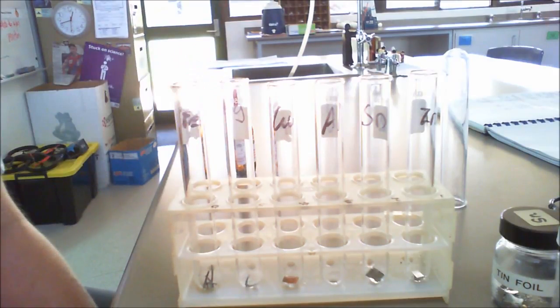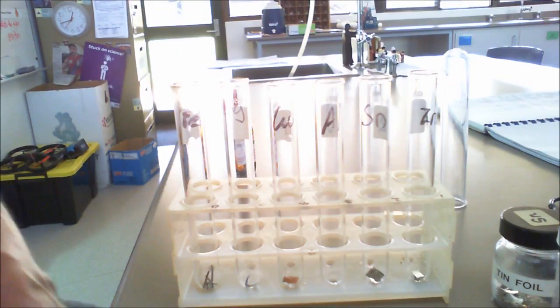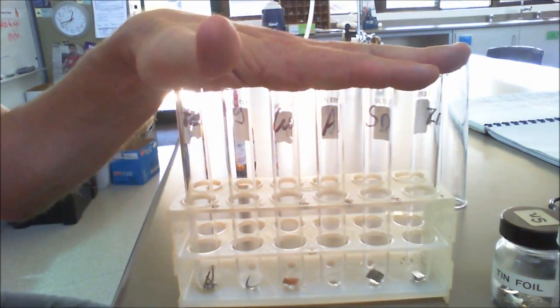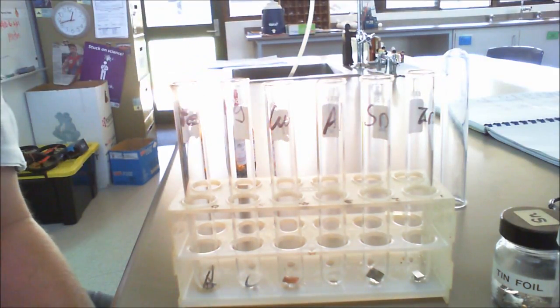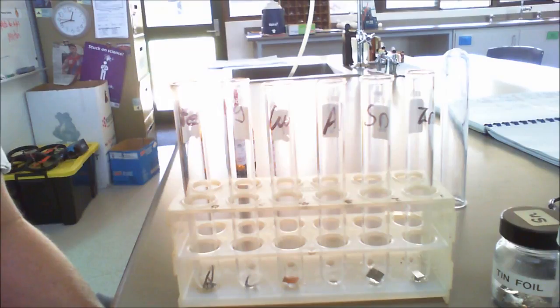Welcome ladies and gentlemen to Warwick Sciences and our filmed practical of acid metal reactions. Today what we're going to do is add an acid to these six metals that are placed within the test tubes here, and then we're going to see what happens as a result to try and figure out the general equation for what you get when you mix acid with a metal.